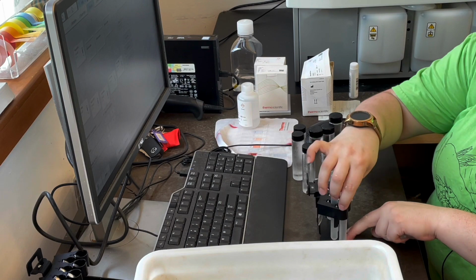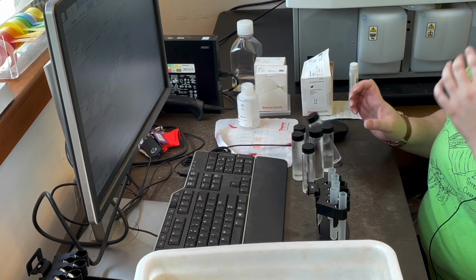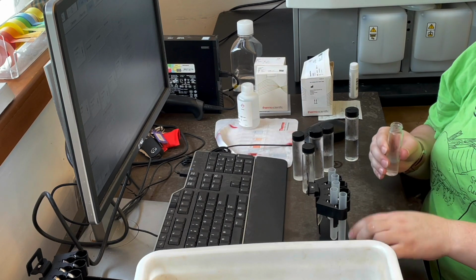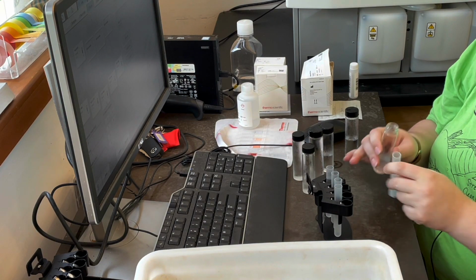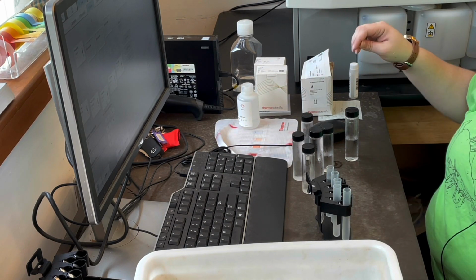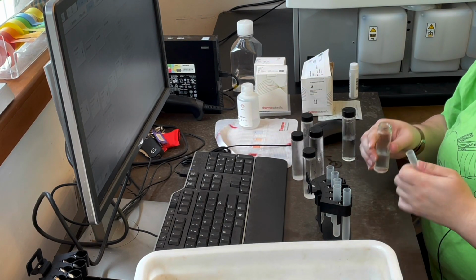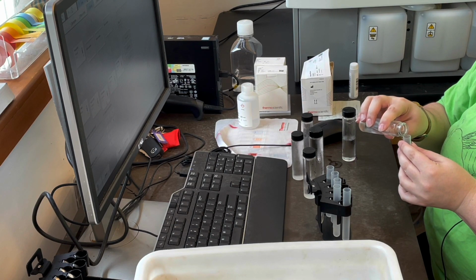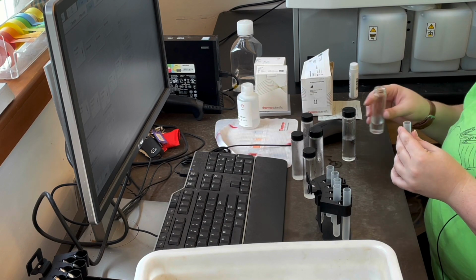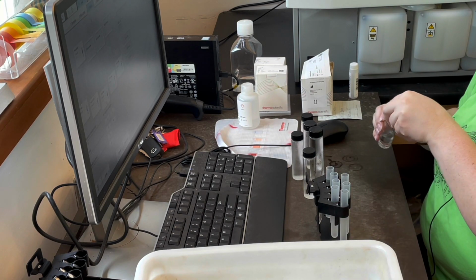And now I'm going to add these standards, which are pre-mixed solutions of the nutrients that we're testing for, so that the machine knows what levels we're looking for, and we can make sure that the machine is working properly. First, I've got the chloride, the nitrate, and I'm just checking the computer here to make sure that I am putting them in the right spots, because it's pre-programmed to know which standards are in which slot. It's a tedious process.